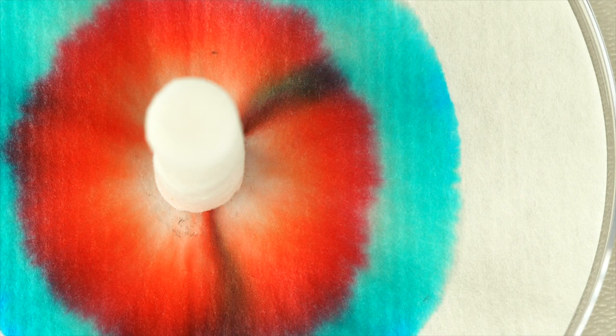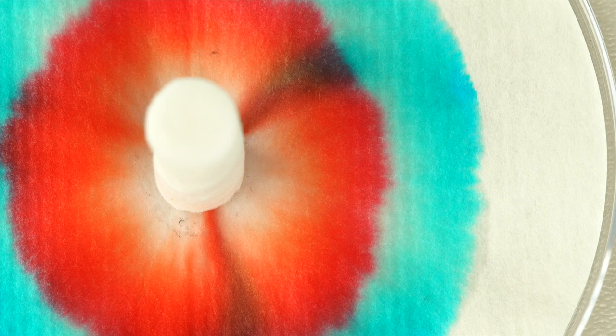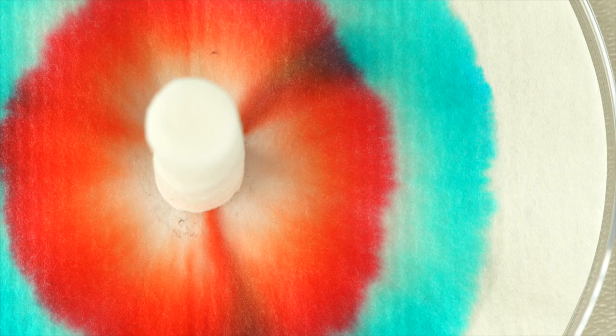You can make black by mixing several dyes. The liquid from the cotton cylinder spreads through the filter paper, taking the dyes with it.